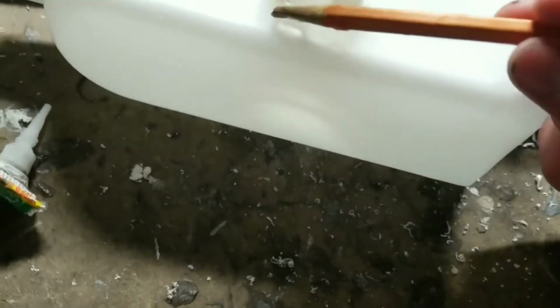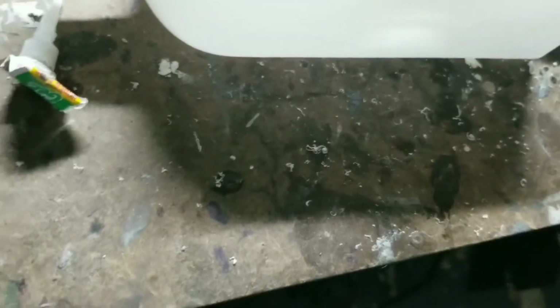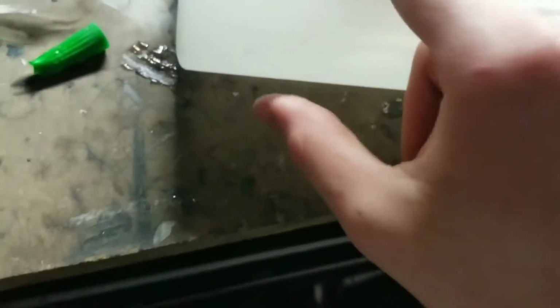First, I have some super glue that I would like to use up. I'm just going to use the super glue to reinforce it, because Flex Seal doesn't create the strongest bonds, as I learned when I worked with it for building my airlock. I actually had to reinforce the Flex Seal with hot glue. But nonetheless, I'm going to put on the Flex Seal after this. Okay, good. Now that it's super glued, let's wait for it to dry.